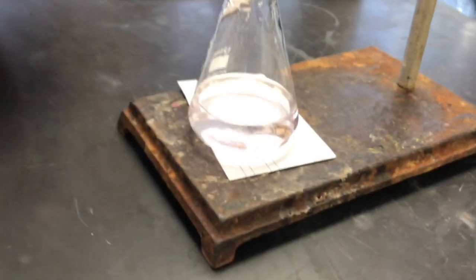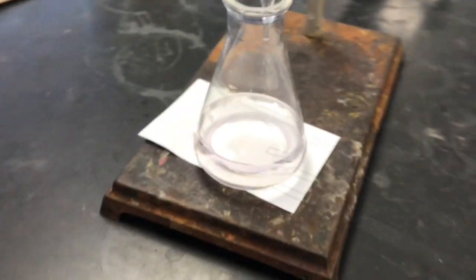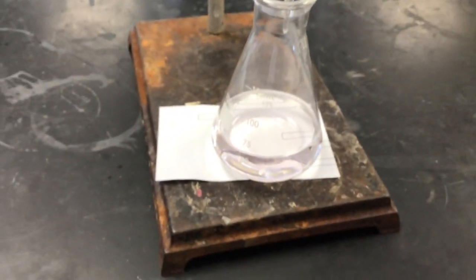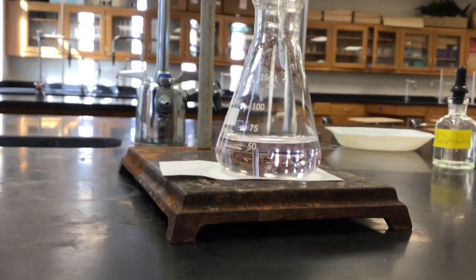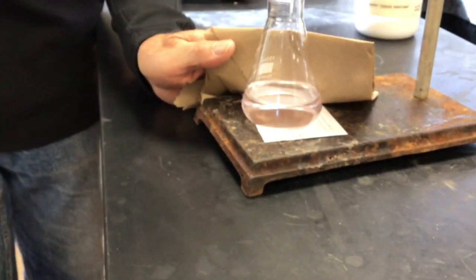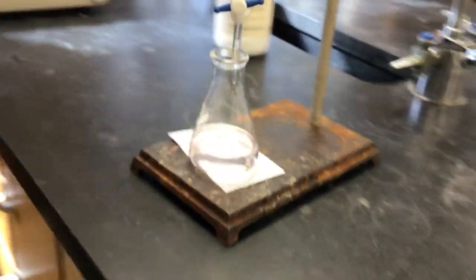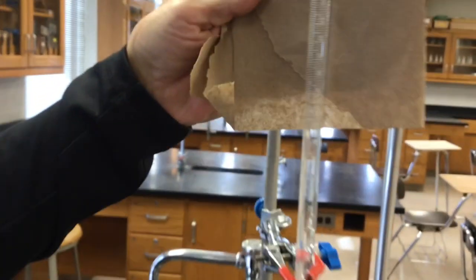It looks pink from my angle. Yeah, I see pink. It's hard to pick up with the camera. If we could turn off half of the lights in the back of the room. Should I turn off the back bank? No, I think we can see that it's pink. It's a very faint pink. It is pink, but you know, when I look at it not through the camera, it definitely is. Okay. All right. Let's read that volume.